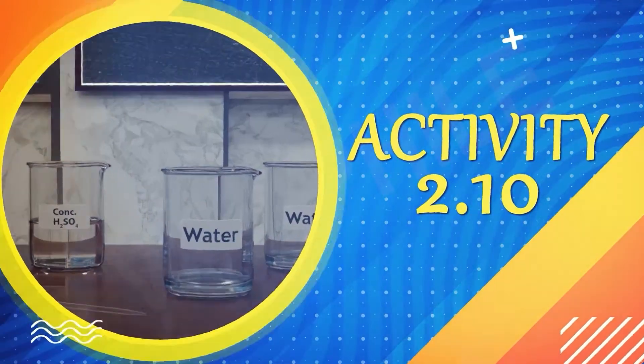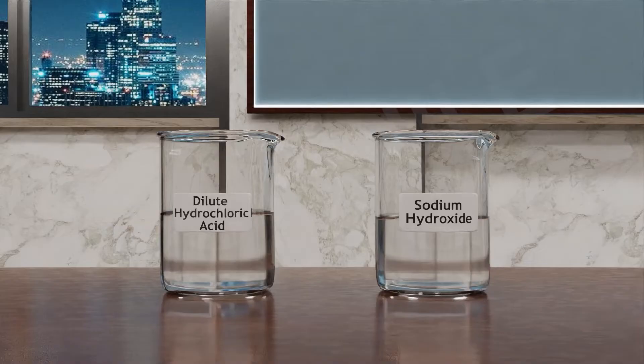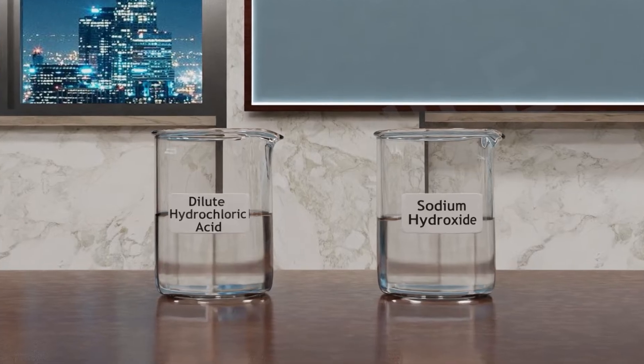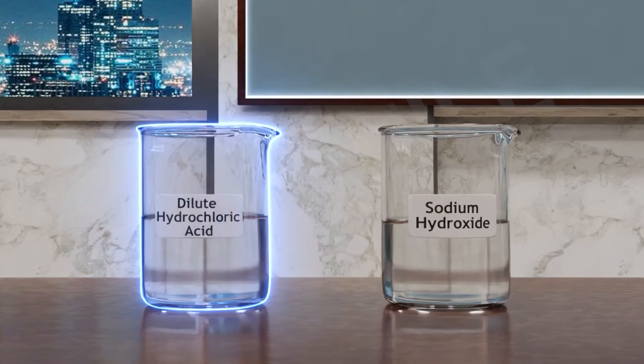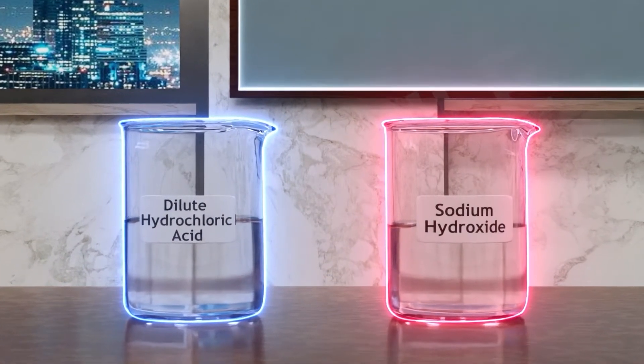Activity 2.10. So have you ever thought what happens when we dissolve acid or base in water? Let's do an experiment.